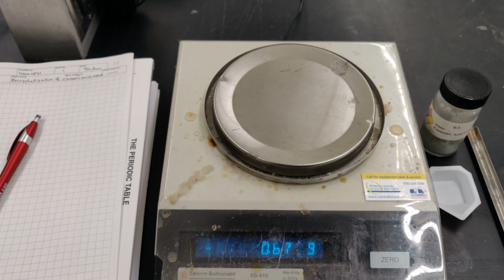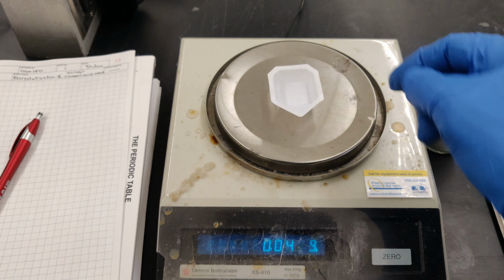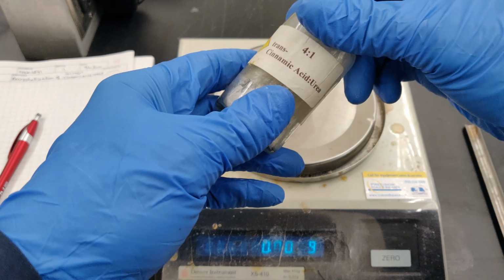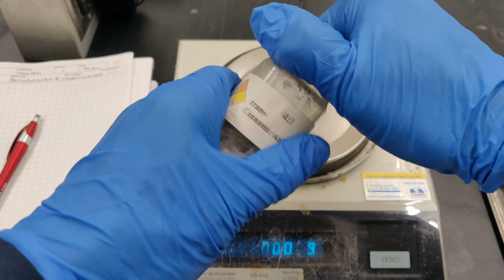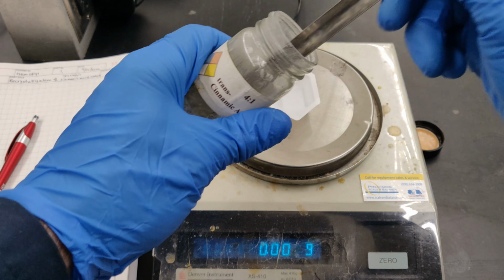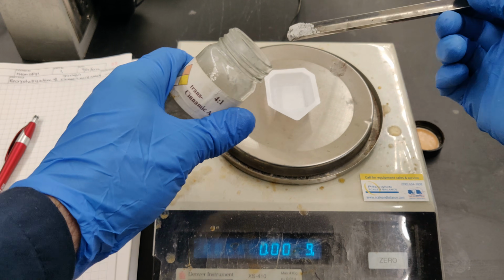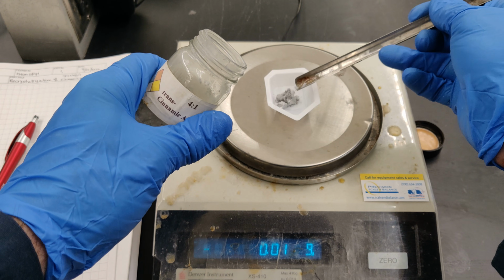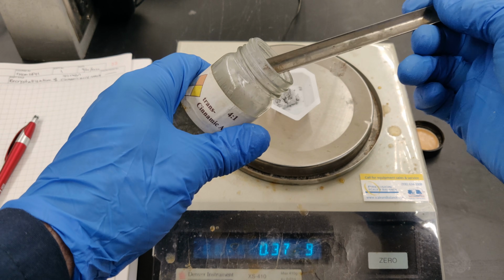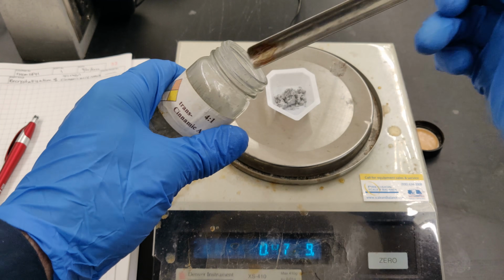We'll start with 0.75 grams of the impure sample, which means that between 0.74 to 0.76 grams must be weighed out. Place a weighing vessel on the balance pan and zero the balance. Note the powdery texture and gray color of the sample, the latter being caused by the presence of a very small quantity of charcoal. The quantities of charcoal and sand in the sample are negligible, and they won't contribute noticeably to the total weight of the sample.